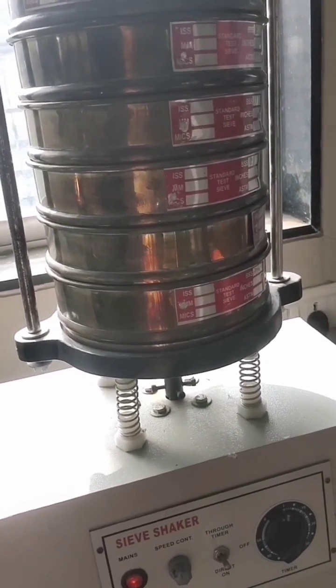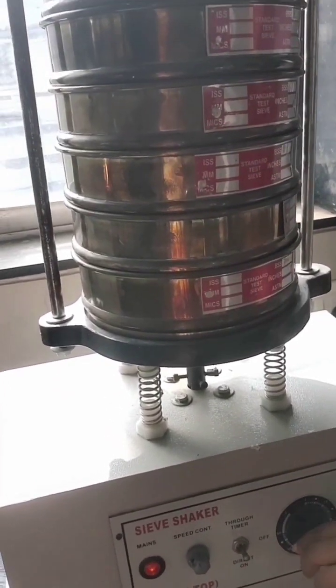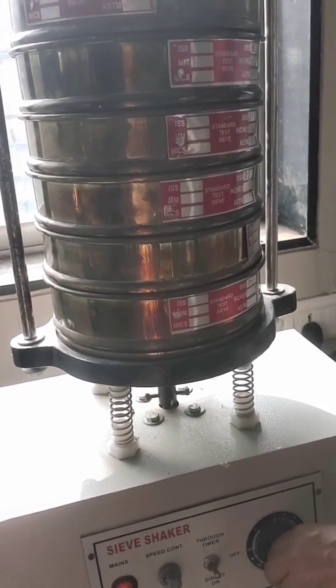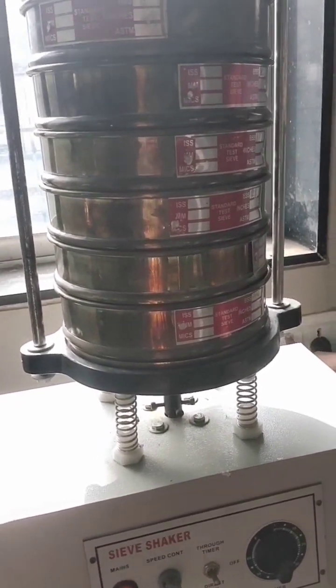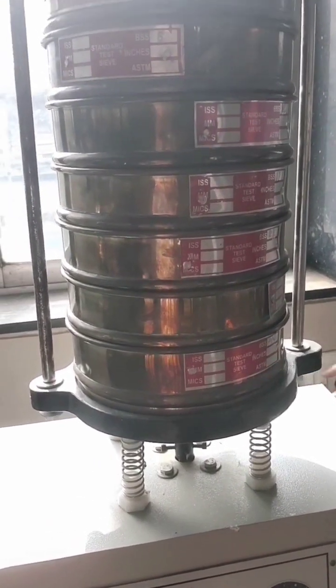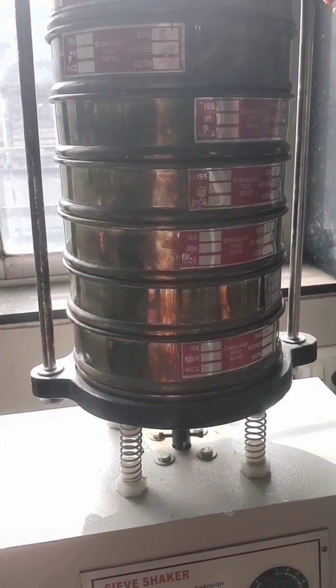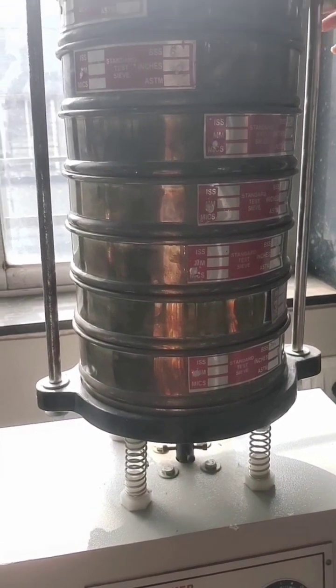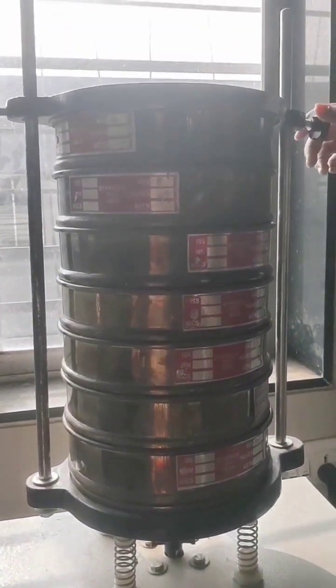Okay, now we have completed 10 minutes. Now we will turn off the switch and see all the particles distributed on each sieve. Now we will open this sieve.